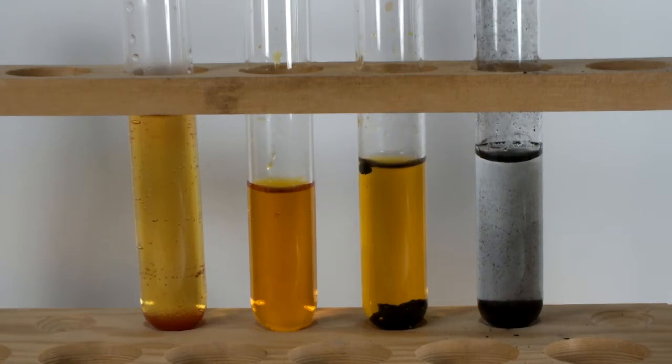The decolorizing carbon was the clear winner. The activated charcoal and the nitric acid lightened the methyl red, but not much. The bright red color that initially appeared with the acid slowly faded to this orange color, and there was some sort of red precipitate at the bottom.